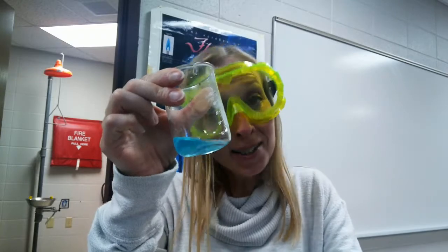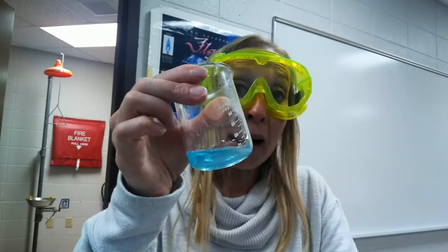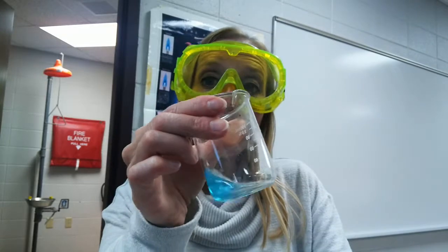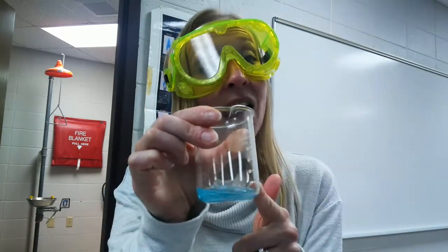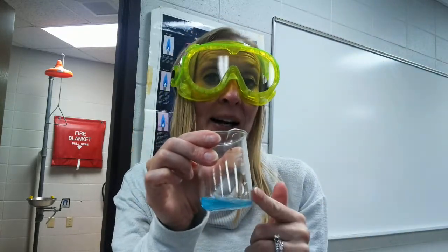Okay, so now we have to figure out how to separate the blue copper ions from the colorless silver ions. You can't just take this solution and run it through a filter and expect that some ions will stick on the filter paper and others will drip through. In order to filter, you need a solid and a solution. So we're going to use something called selective precipitation, where we're going to try to precipitate only one of the ions and then leave the other one in solution, so that one ion will drip through the filter paper, and one ion will stay on the filter paper as a solid.